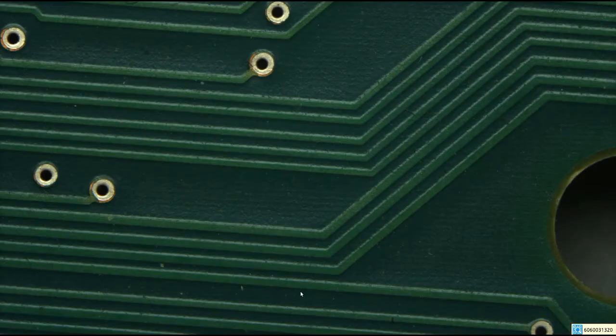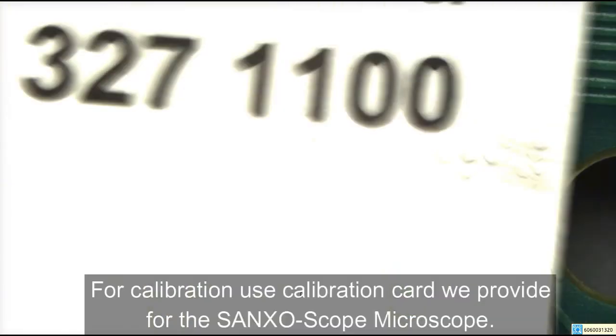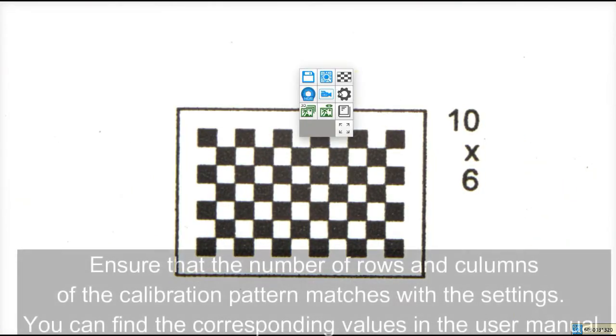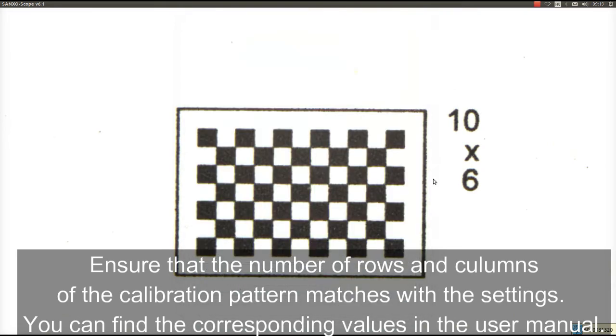Use the calibration card that we provide with the microscope to execute the calibration. Place the card under the camera, make a right click, go to Settings. Check the pattern on the image is the same as the setting. Press OK and then right click on the icon, select the calibration icon, and the system adjusts the calibration immediately.